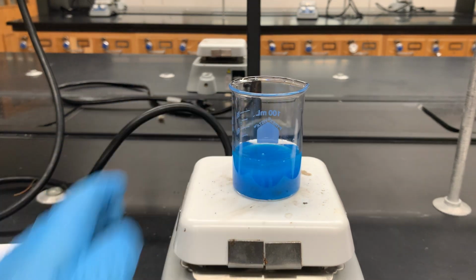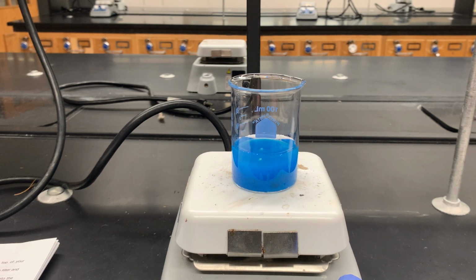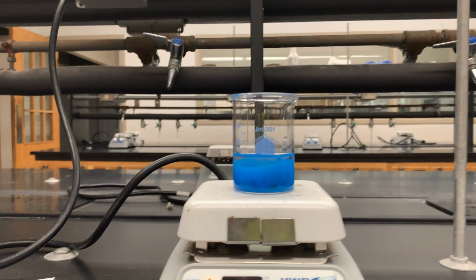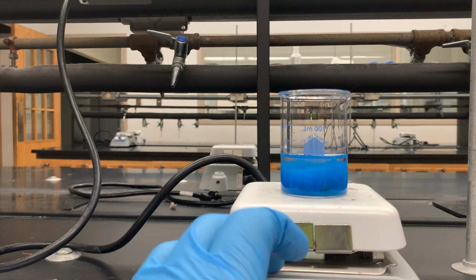So we've got it stirring, we want to keep it stirring, and you know what? I'm going to adjust my stirrer up a little bit, because I want to make sure that solution is definitely mixing up very thoroughly. And I'll actually drop the side view down a little bit more, and you can see that copper solid is definitely mixing up.